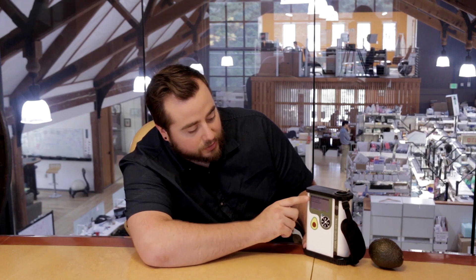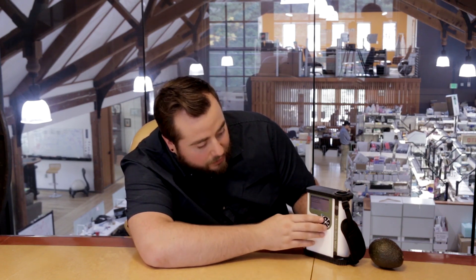If you would like to change that, or if you need to do any adjustments to the measurement, simply click the right arrow to see the options of deleting the measurement, entering a lot manually, selecting a lot from list, or selecting a recently used lot. To go back to your screen with your measurement, just click the left arrow, and from here you can click the left arrow again to navigate backwards in your organizational tree.